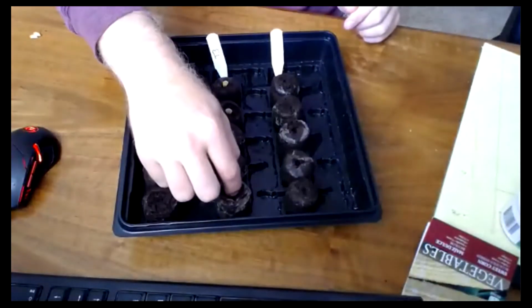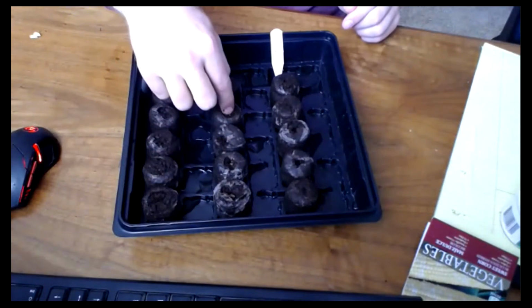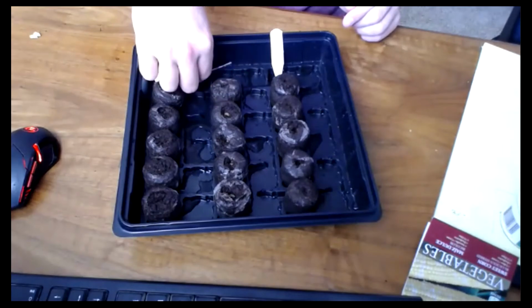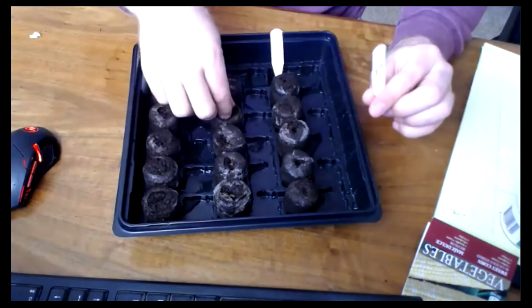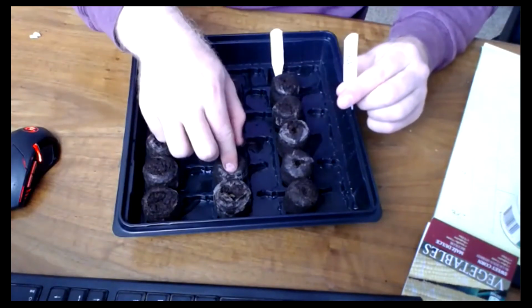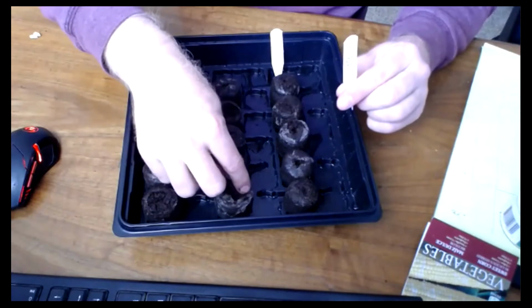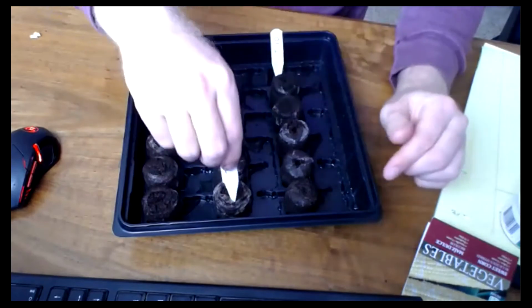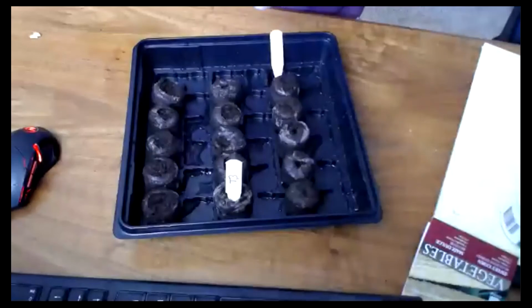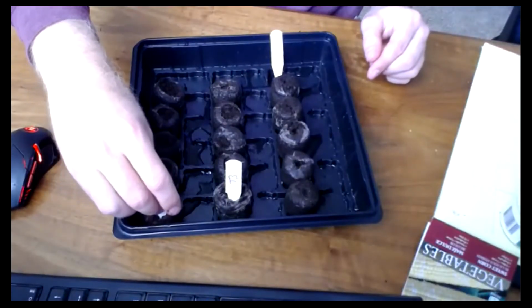I'm just going to do the same thing. I'm just going to plant them by pushing them straight in there. Cover them up a little bit with that peat in the peat pot, or the little peat container. And this is treatment number 3 that we're setting up right now. Make sure that these stay watered, right? These are biological organisms. At this point, I think we're all good plant people by now. Treatment 2 and 3, I'll stick those tags in the first one on the row.